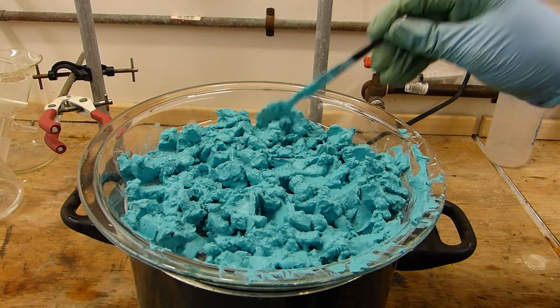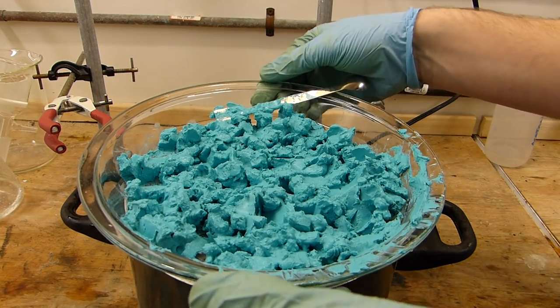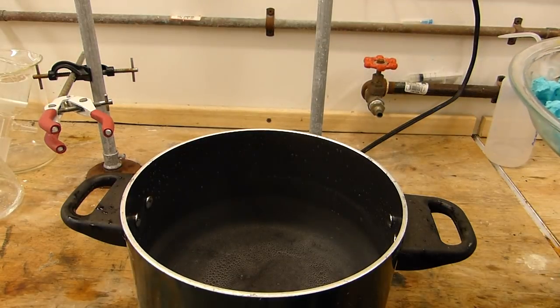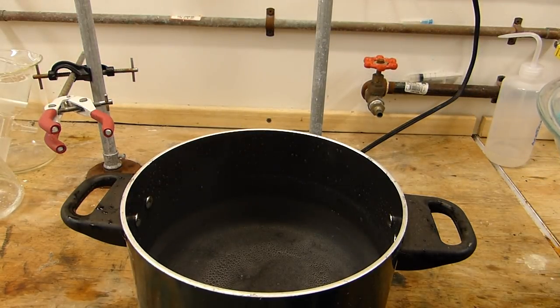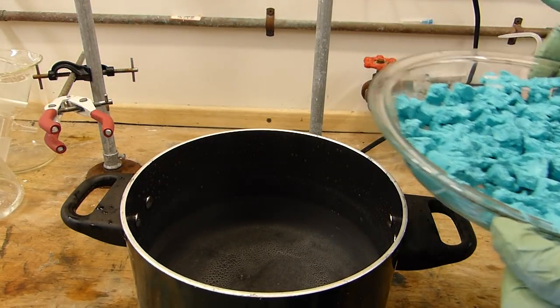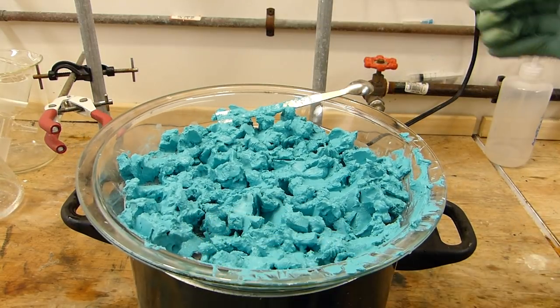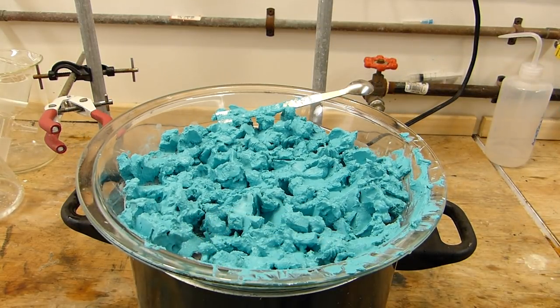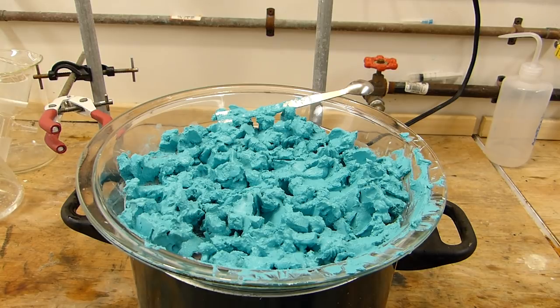All right, so I've spread this out on the glass pan, as mentioned before, about as evenly as possible. And I've got it on top of a steaming water bath here. It's not quite boiling. It's just set to simmer. It's just an electric pot and this should get this stuff dry in no time. So I'll leave this for a couple of hours and we'll come by and stir it every so often. That should be about it.